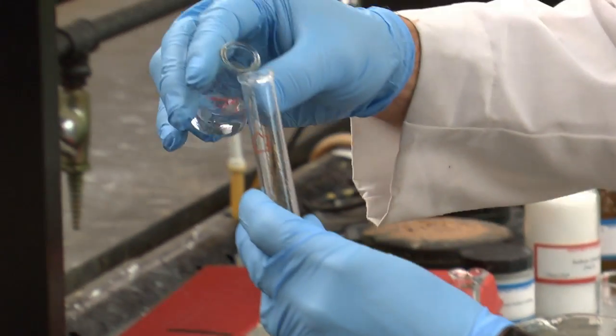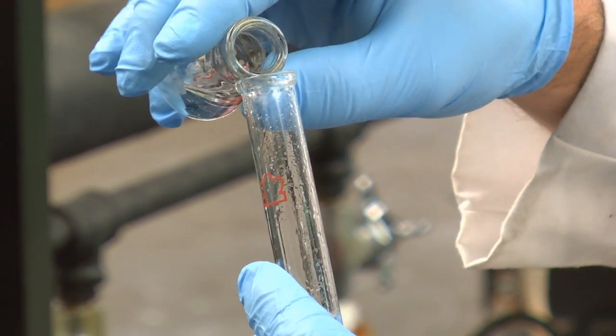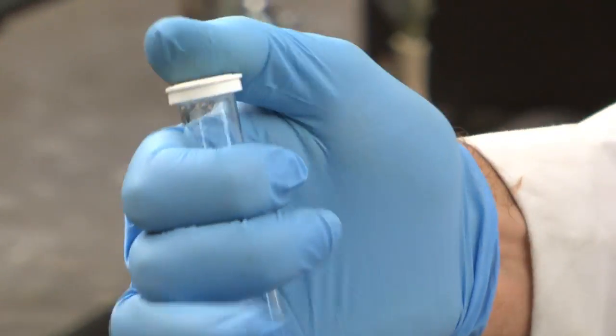Okay, I'm going to add about that much ether again. Shake it up.